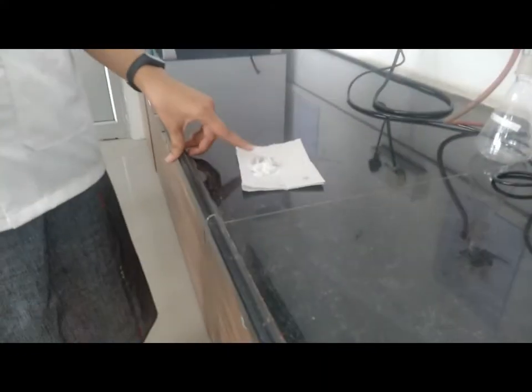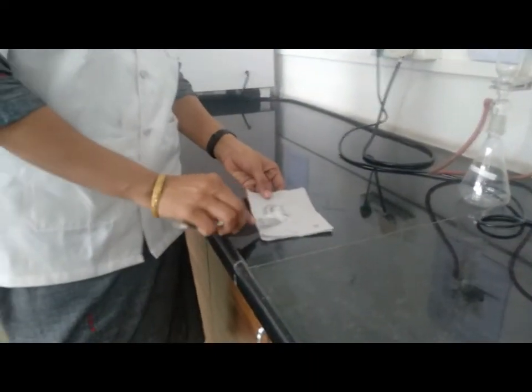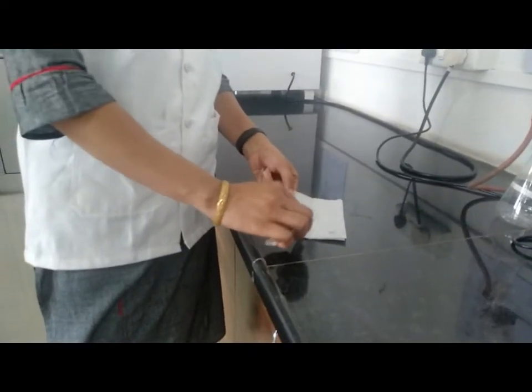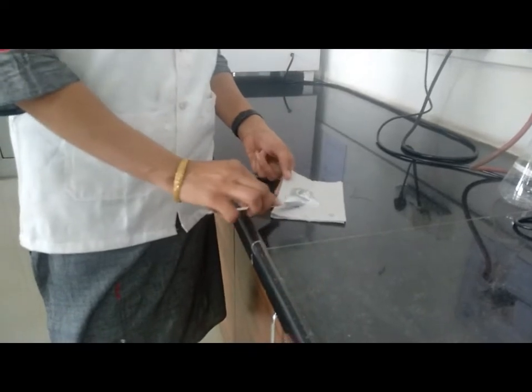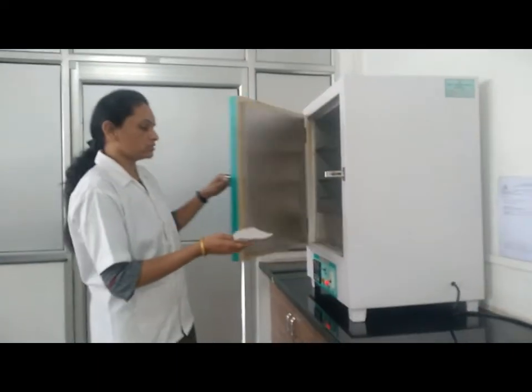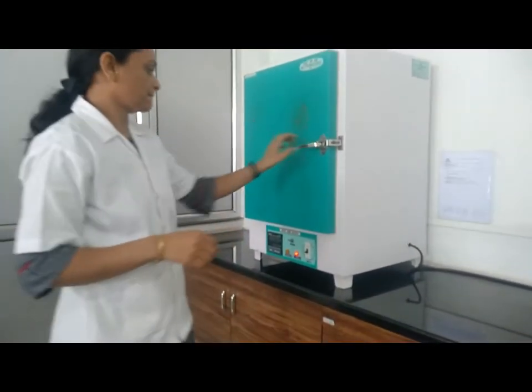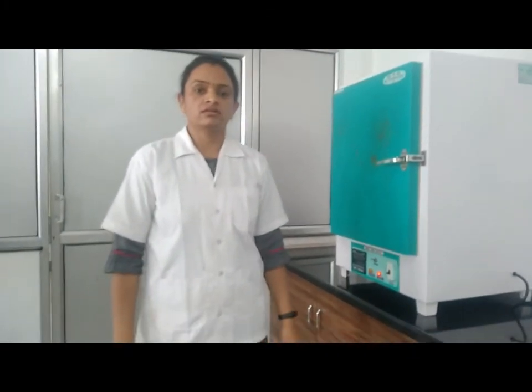After filtration, we got the final product which is washed with water and recrystallized by alcohol. This is our final product. Now this final product we have to dry and then take its weight. For drying, we have to put it inside the oven and then wait for 2 hours so that our compound is dried.